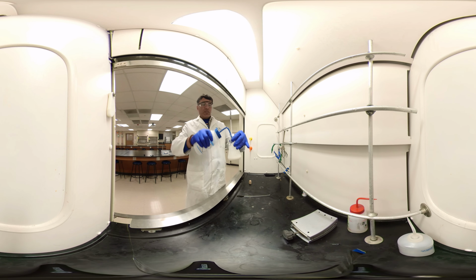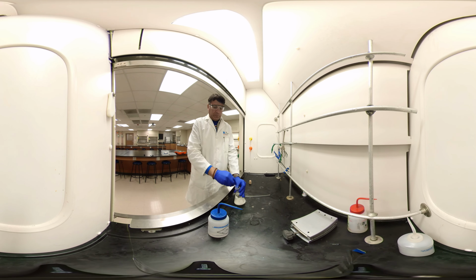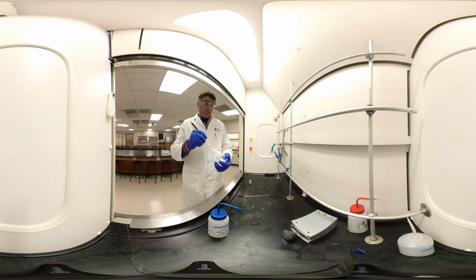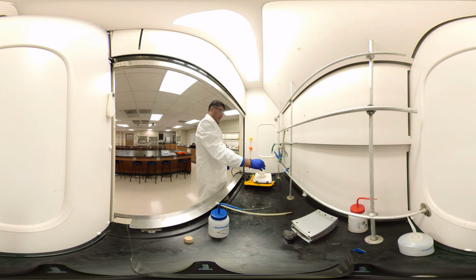Let's first dissolve the solid in deionized water. Keep adding slowly and keep stirring until it dissolves. Okay, the solid dissolves completely. Out of these two components, one is soluble in organic solvent, one in aqueous or water. I added some water here. I'll use the magnetic stirrer to dissolve everything. Stir it.